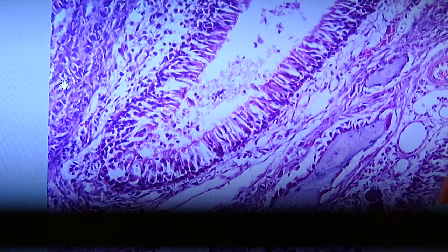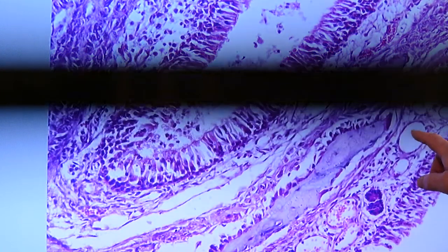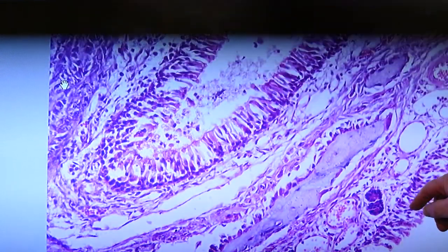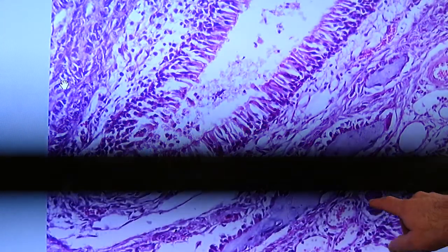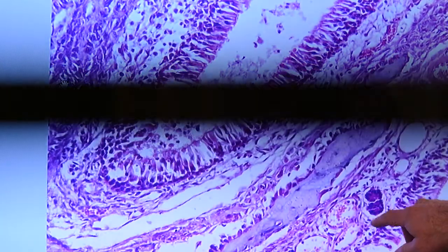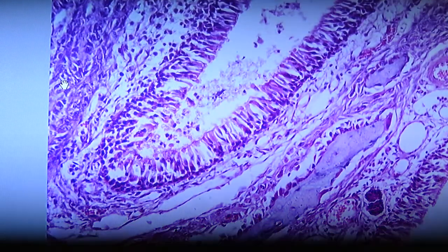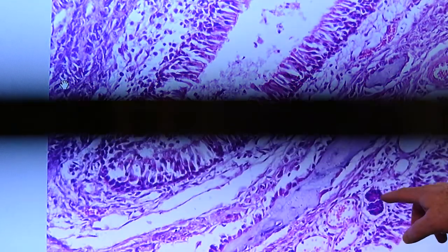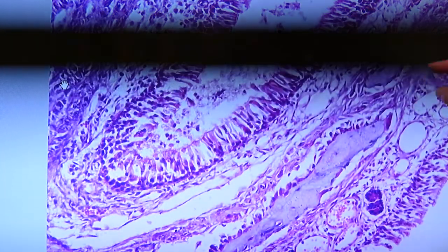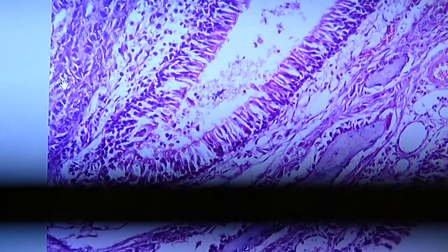There's an artery right here and either a lymph or venule right here. These are Bowman's glands. More venules, they have blood in them, so I know they're not lymphatic vessels. So there could be lymphatic vessels, veins, venules, arteries, arterioles, all that in that as well, of course.